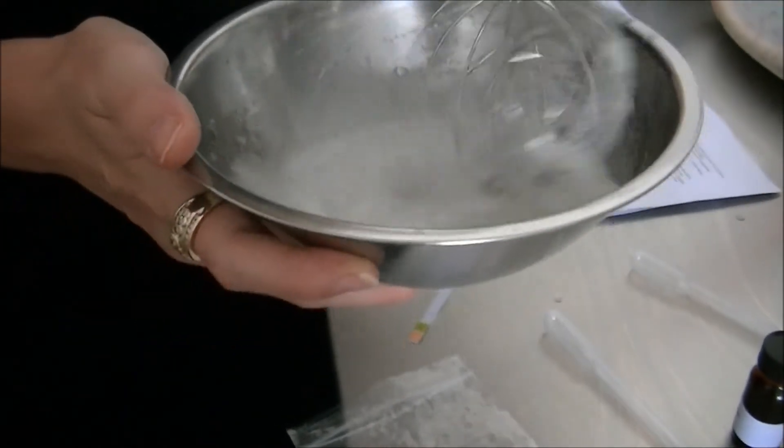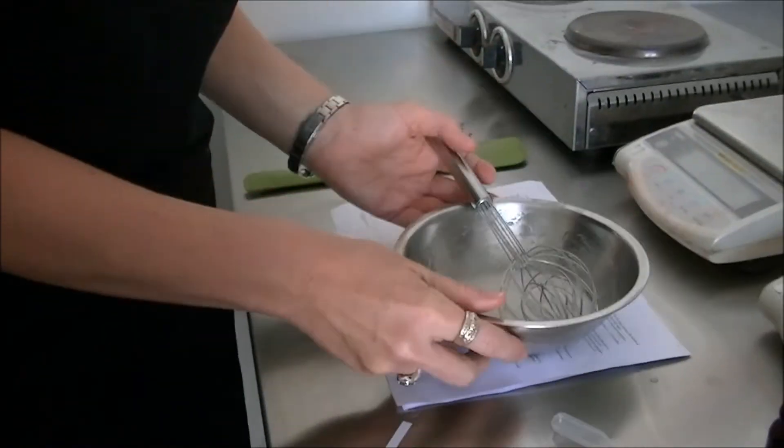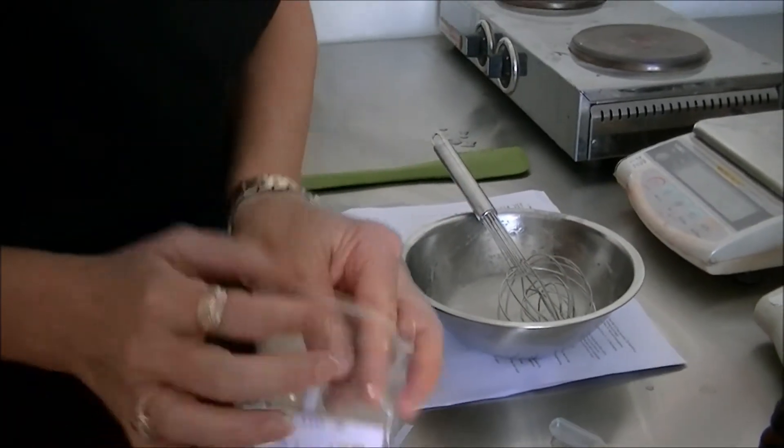Again, we need to let these dissipate. You can see the viscosity has changed slightly. We need to check the pH again.